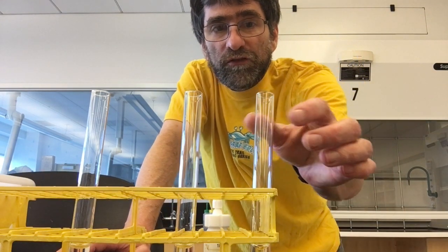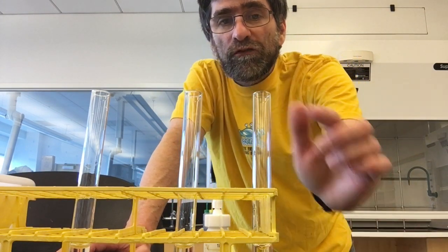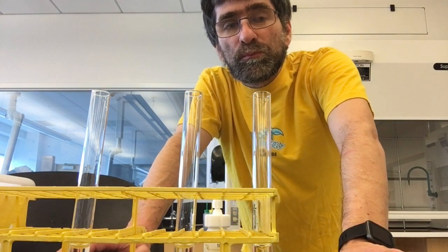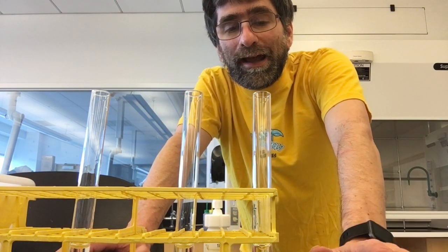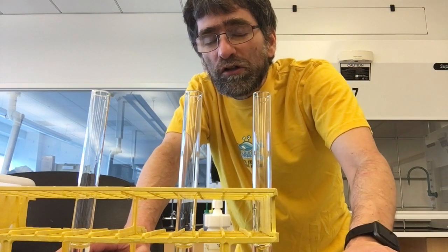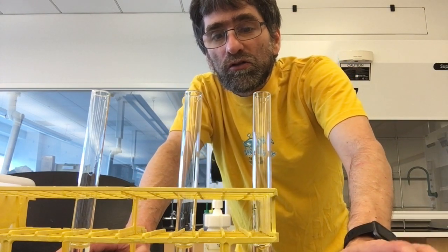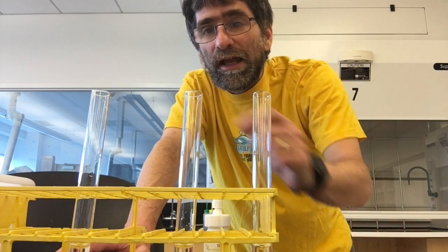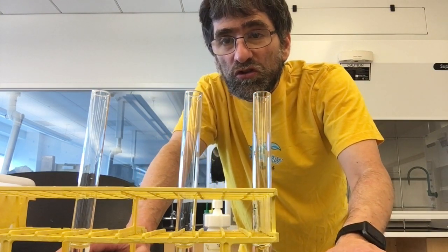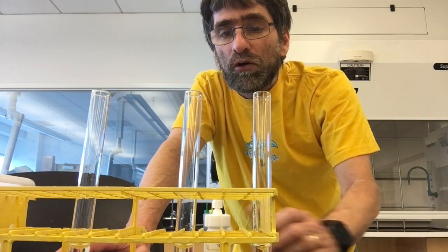I have three test tubes here. All three of them have two milliliters of water. The first one has chloromethane, a methyl halide. The second one has 1-chloroheptane, a primary chloro organic compound, and the third one has t-butyl chloride, which is a tertiary chloro organic compound.